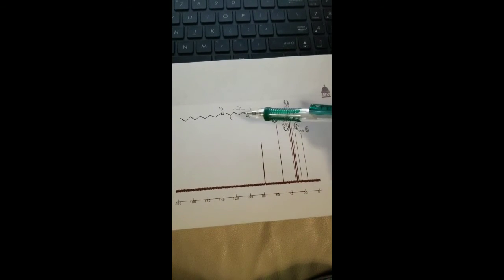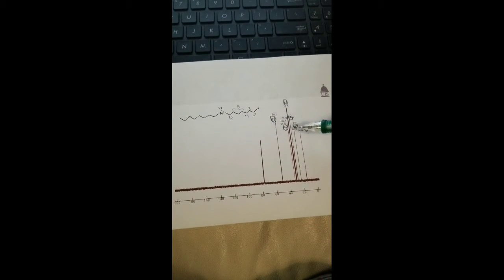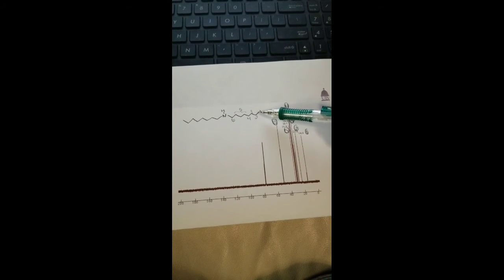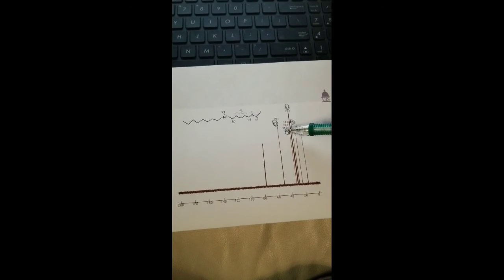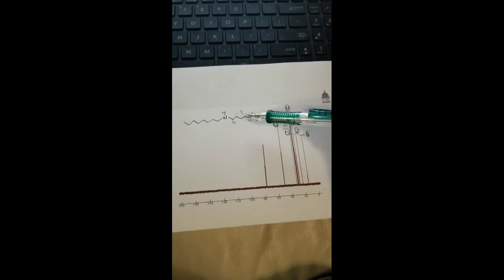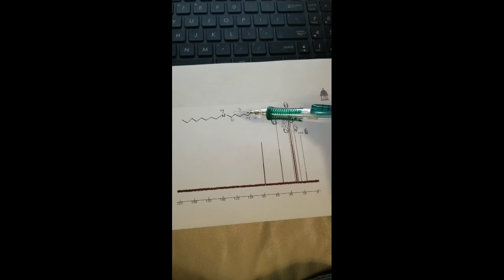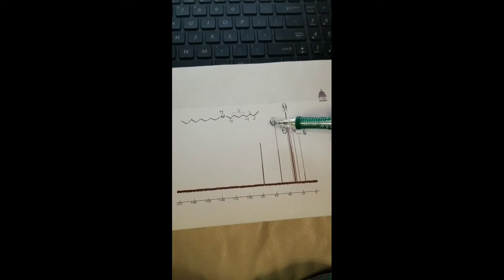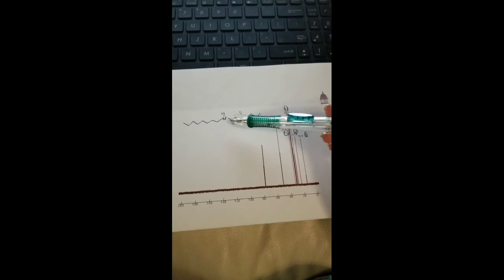So the farther we get from the nitrogen, the lower these numbers go. You can see at 14, we're going to have this farthest carbon, and that just is going to continue. And we see that spike number 5 has 3 values for it, so we can assume that that is indicating these 3 carbons here. And finally, this spike here represents this carbon that's closest to the nitrogen.